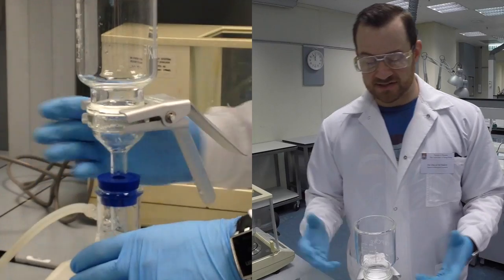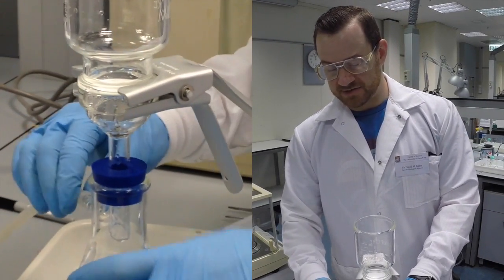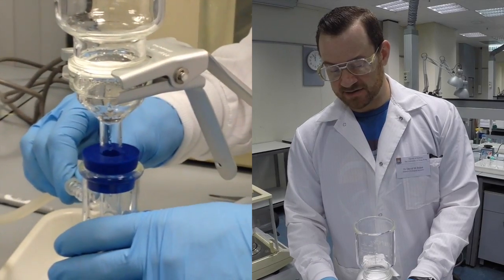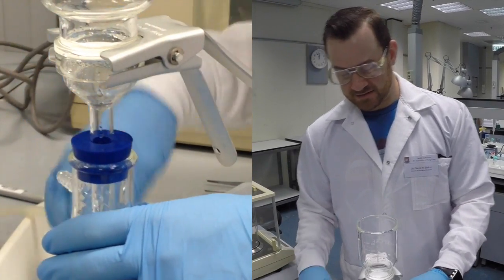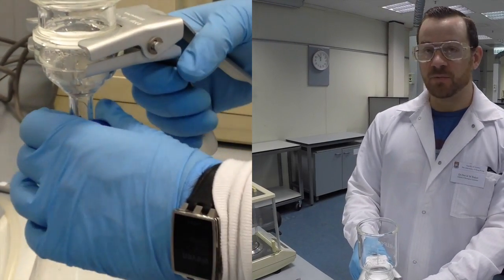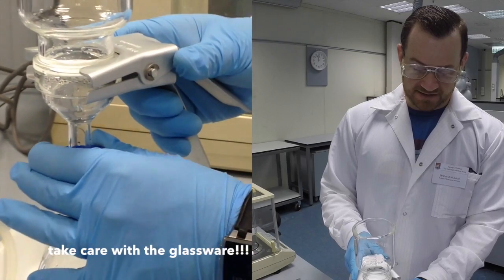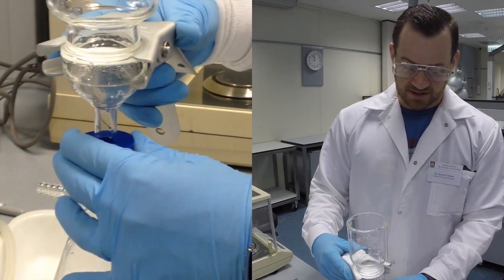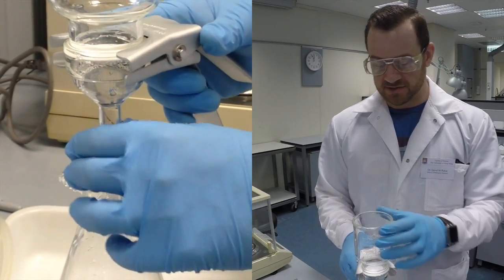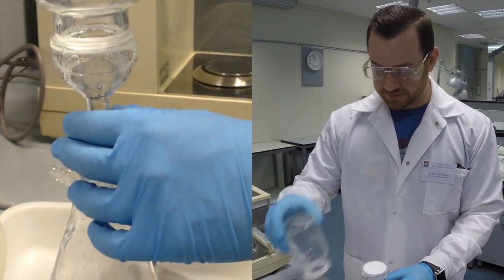So in order to disassemble this, it might still have some vacuum pressure inside, so I'm just going to disconnect this sidearm tube, and you can hear the vacuum release. And then depending on what I need to do, if I just need to empty it, I can remove this whole apparatus from the silicone plunger or seal. And that's actually not moving right now for me, so I'm going to be more careful and conservative and disconnect everything from top to bottom.